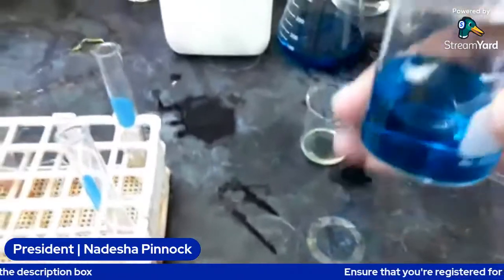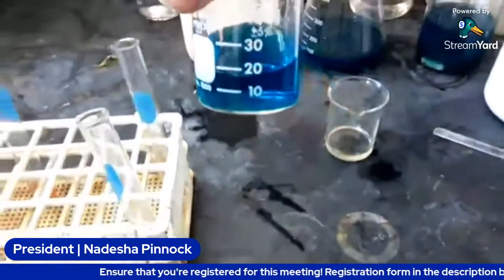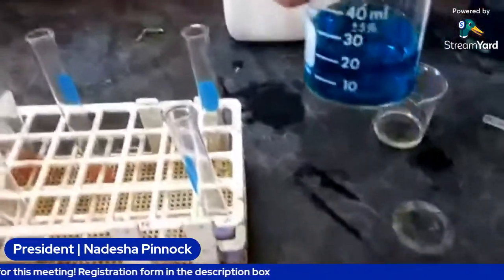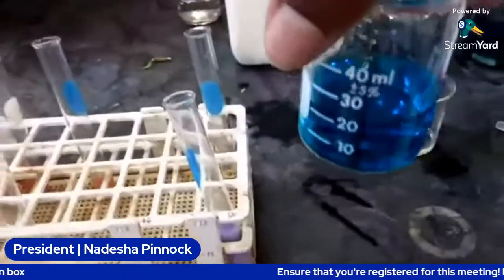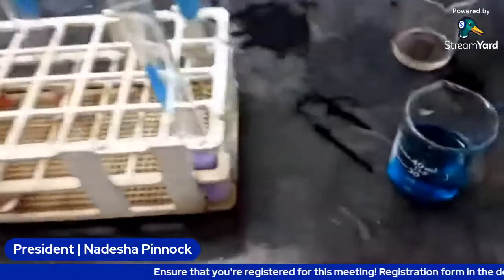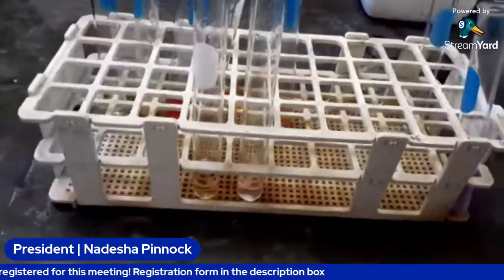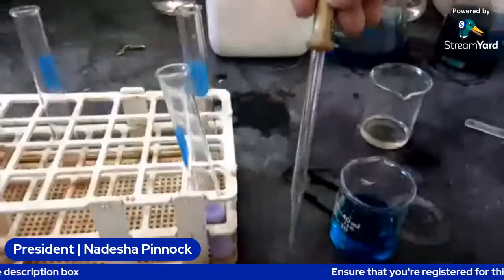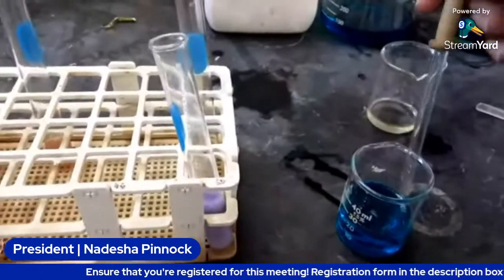All right, so we're getting a dropper. This is our Benedict solution or our Benedict reagent. I made it not long before the club meeting, and maybe at the end of the meeting I can show you guys how it's made. But I won't be making a new batch because we have a lot. So that is our Benedict reagent. And we're going to take 3 mils, which this dropper should be approximately 1 mil. So we're going to add 3 mils to each of the test tubes.